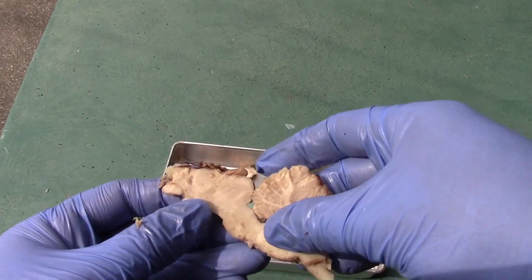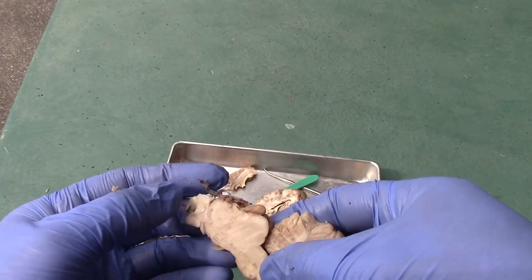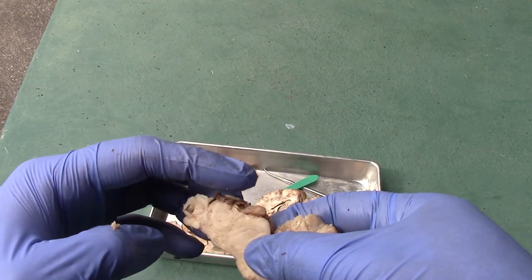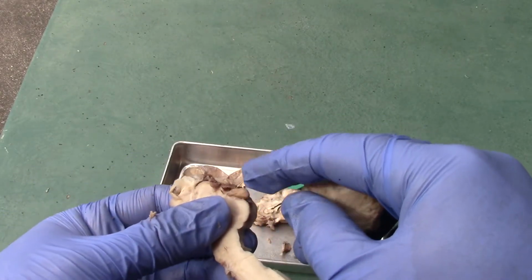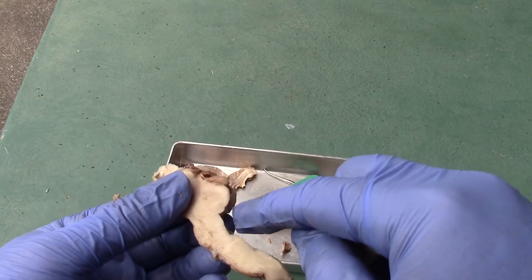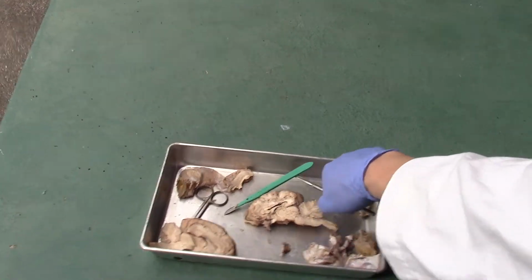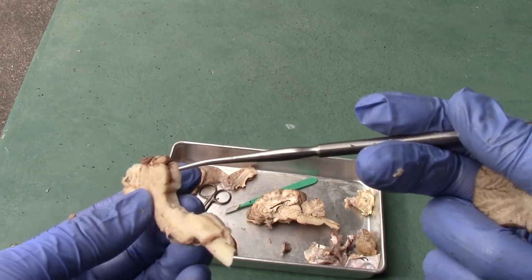So here I went ahead and took off most of it, and here you have the third ventricle being where my finger is at. You still have that pineal gland that you see over here, the corpora quadrigemina, the superior colliculus, and the inferior colliculus that you see from here, superior, inferior, right?